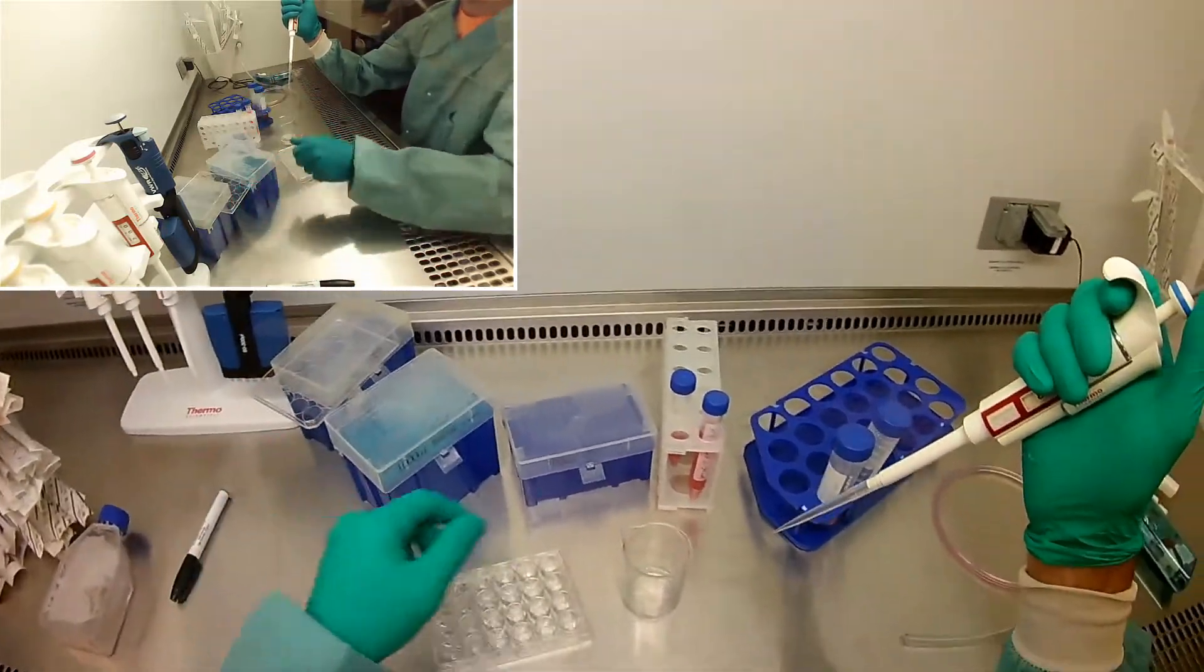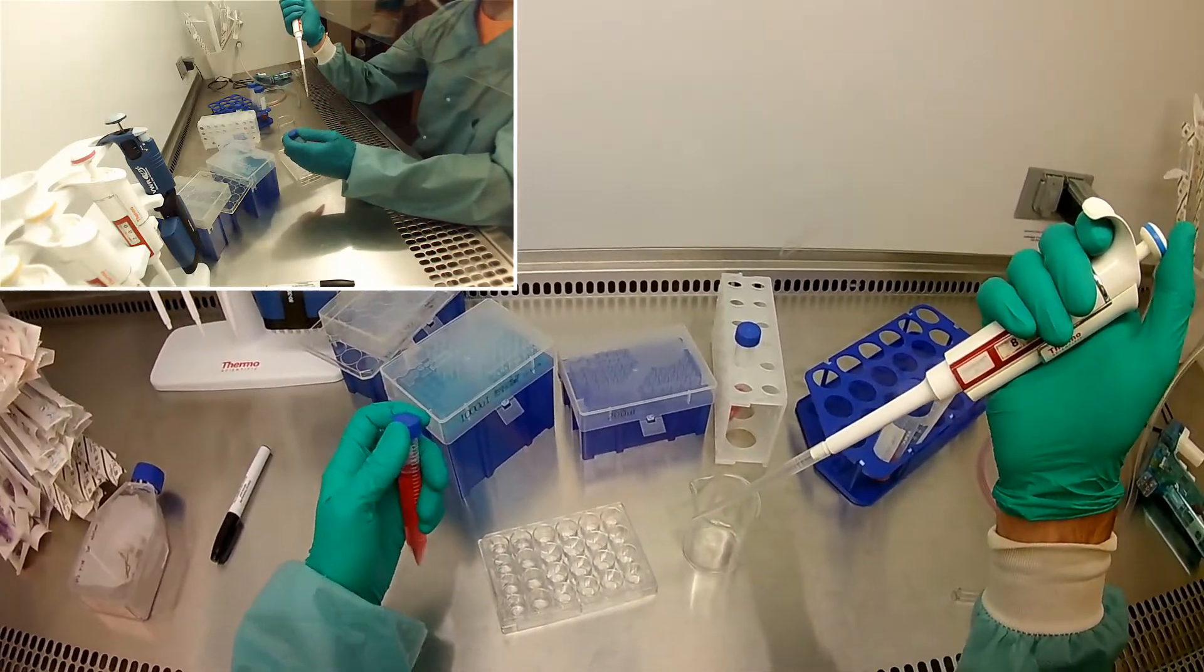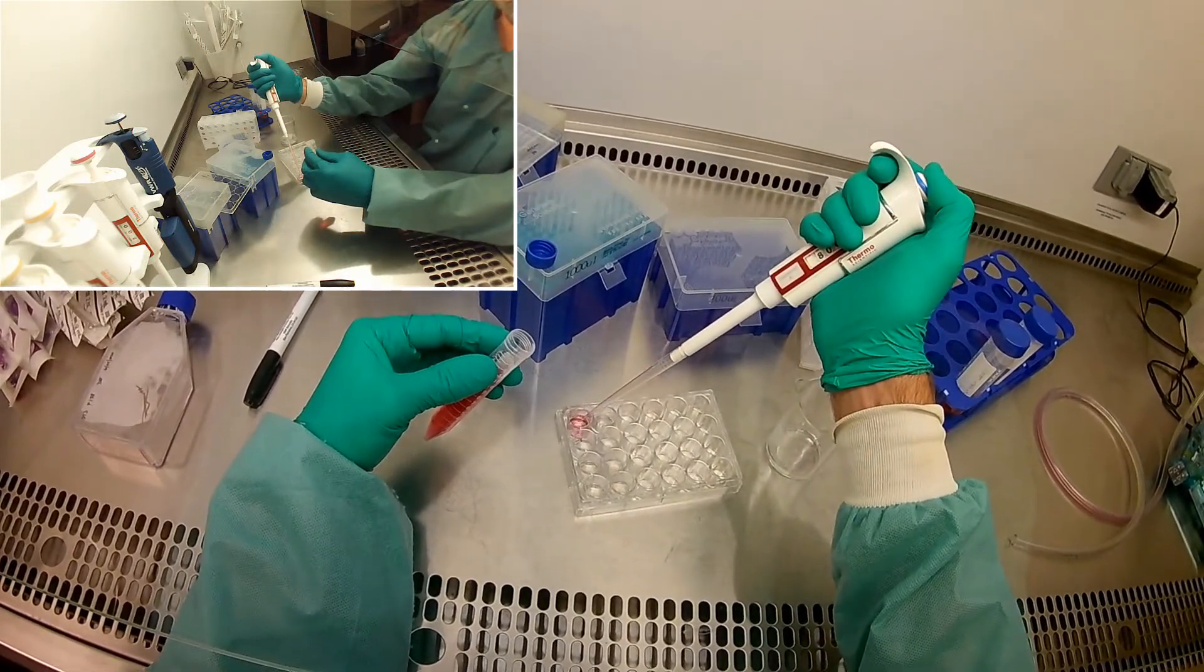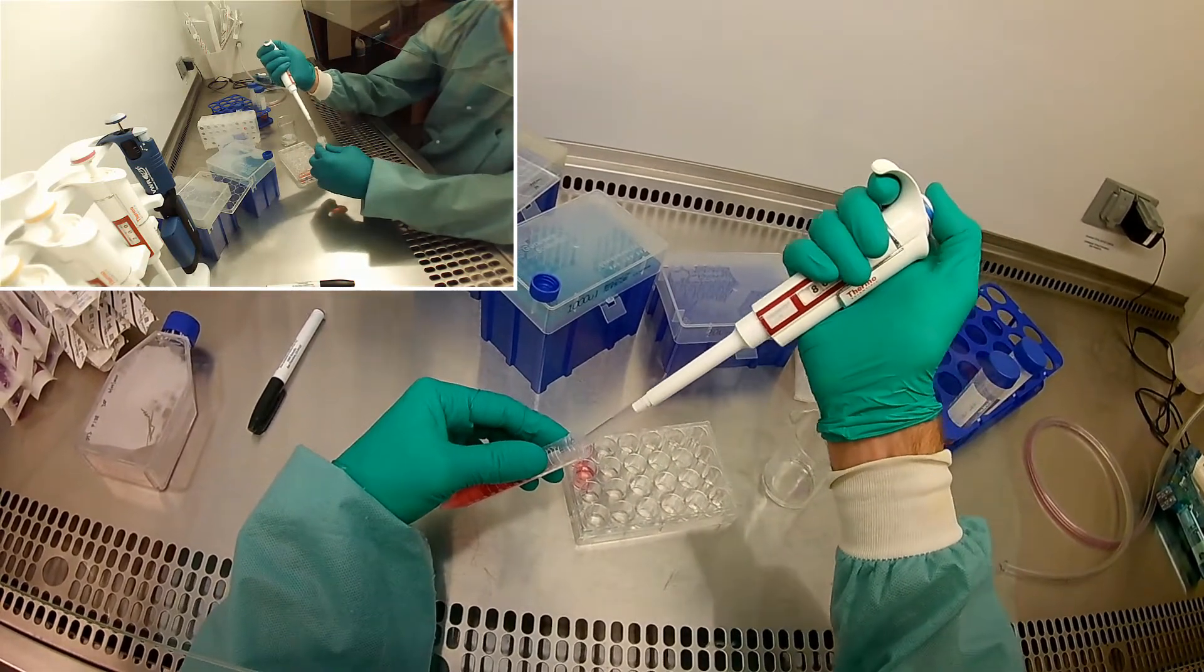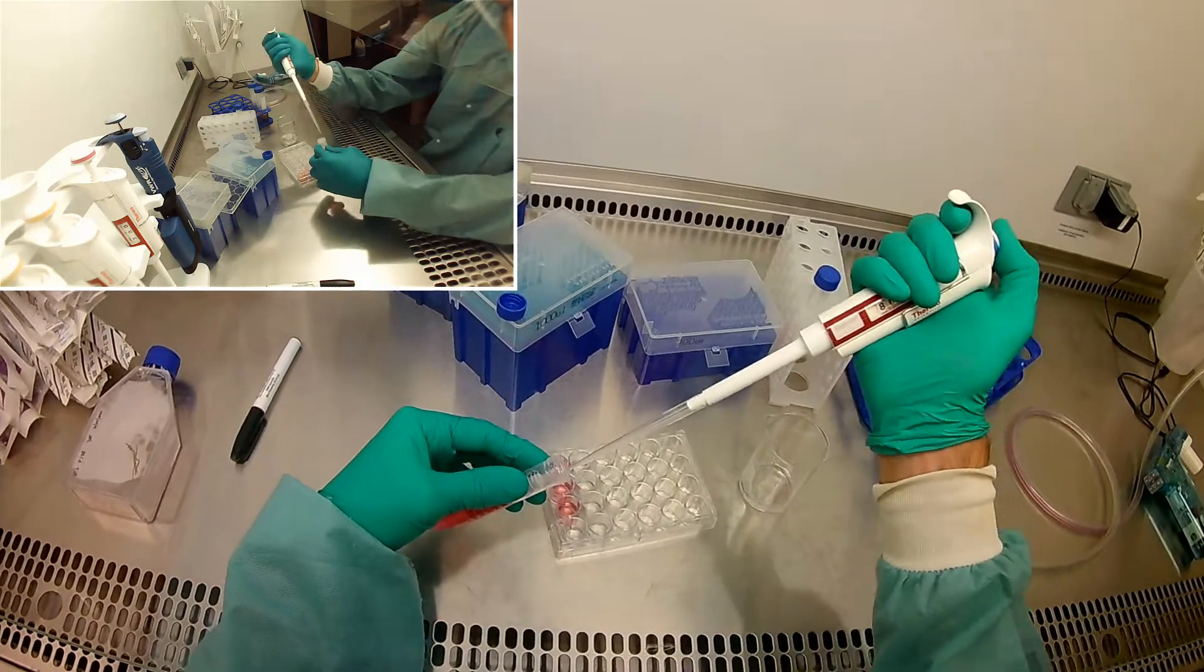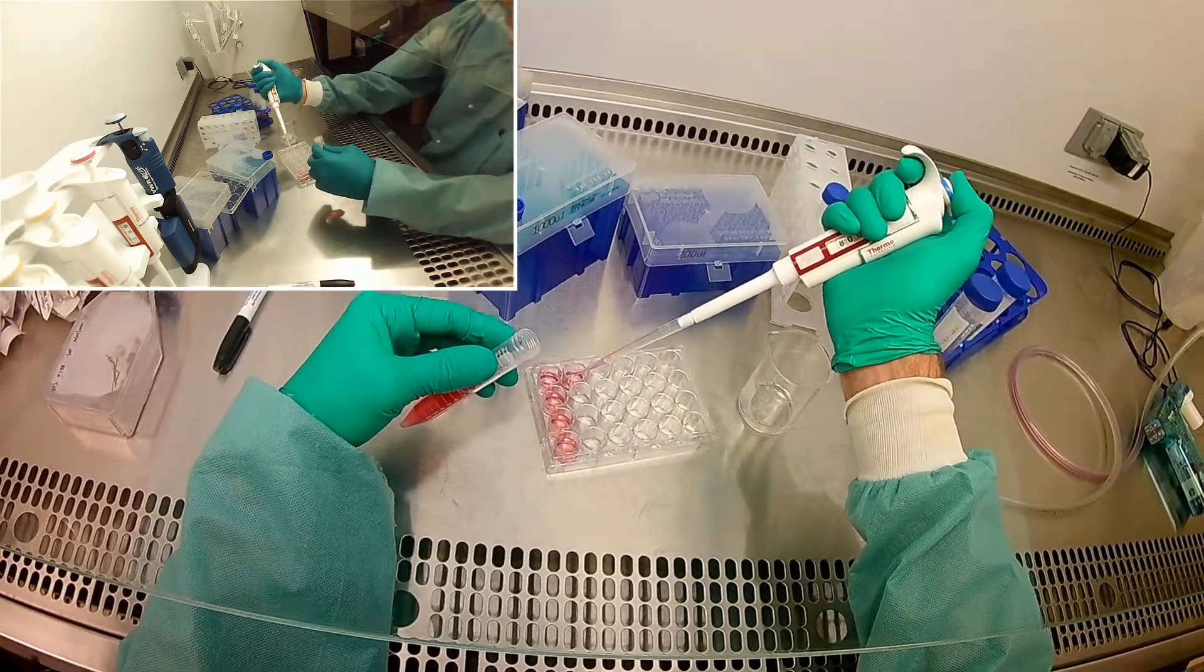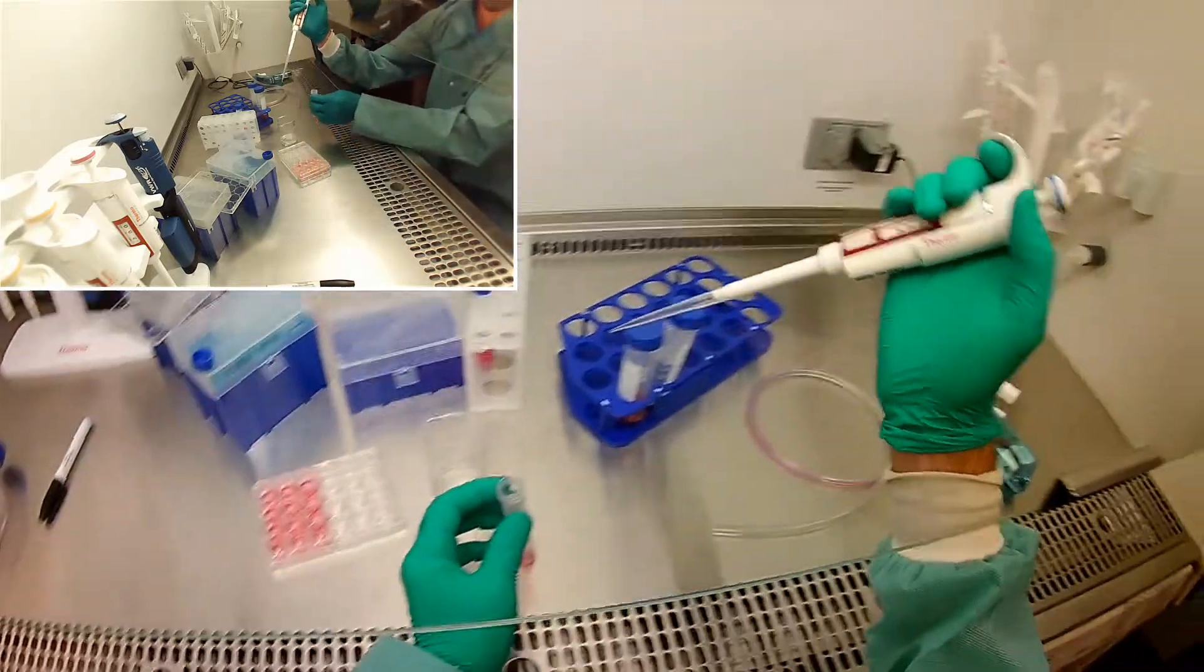Okay, I want to be a little bit quick on this to prevent cells from settling. So you see my hand went over that. That would be a huge no-no if I wanted to keep this 100% pure. But I'm not really at that point right now, so we're okay. Again, this is only going in there for an hour and a half. So I'm not making bubbles by pushing down to the second stop. I'm also trying to be gentle about putting it in there, hopefully keeping the liquid on top of the hydrogels rather than getting underneath so I'm not squirting with all my might. All right, so we've seeded 800 into each.